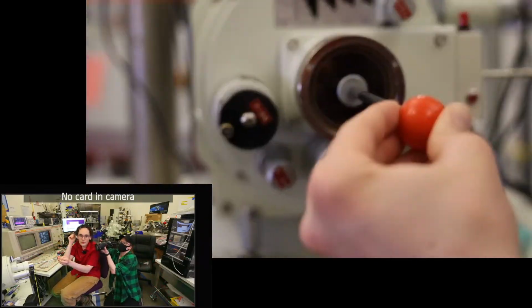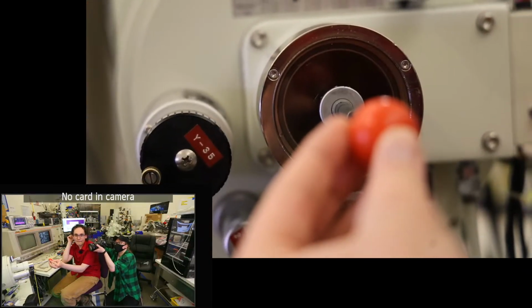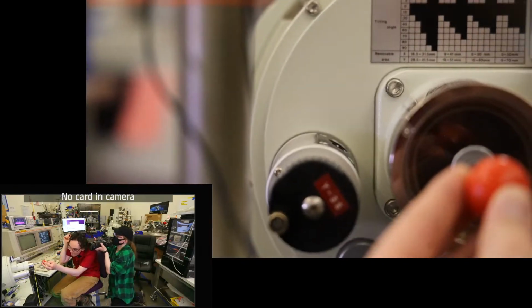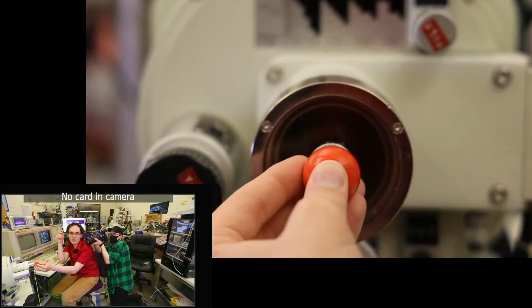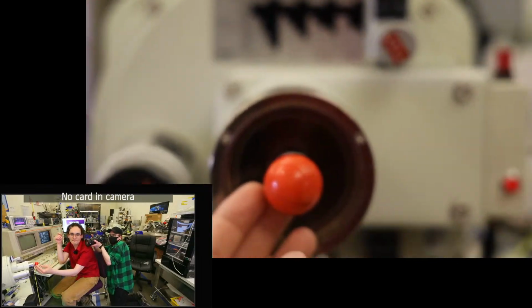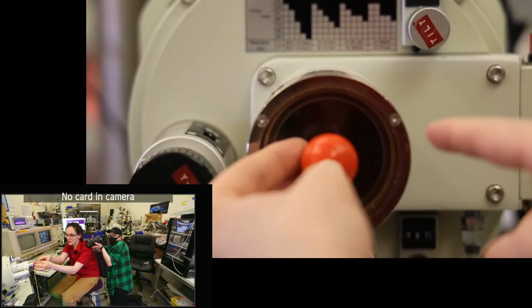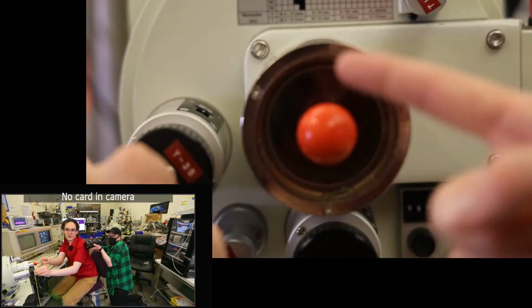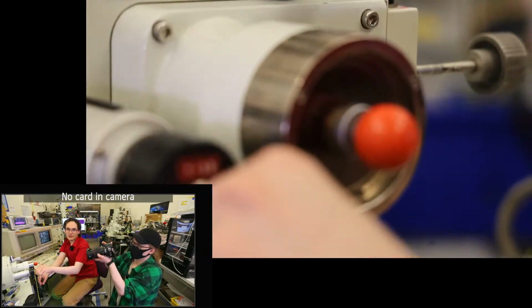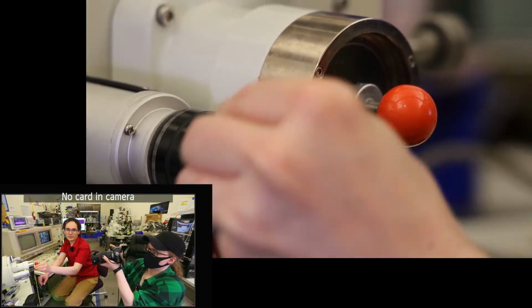We're gonna push our sample rod in. Oh, I gotta bring it up one because we're doing the shorter holder. Okay, so I'm on the dovetail. So the sample rod's gone all the way back in. So what I have to do is move the stage. So you see the sample rods, if you want to look at it from the side, sample rod's connected to the stage right now. And so by moving the axis of the stage, I'm bringing the sample rod out far enough to be able to unthread it.